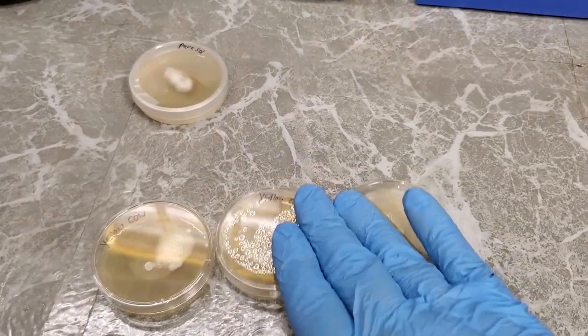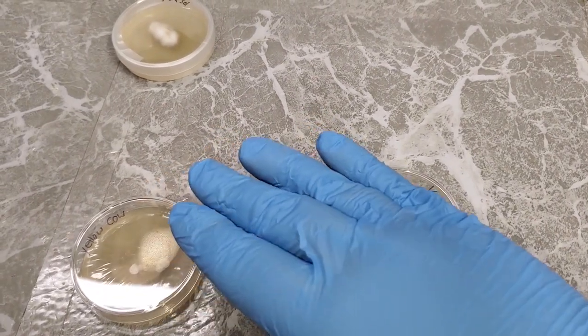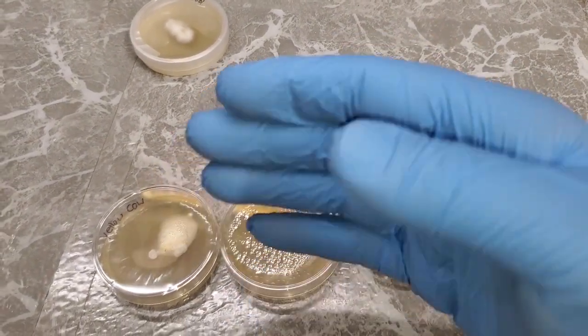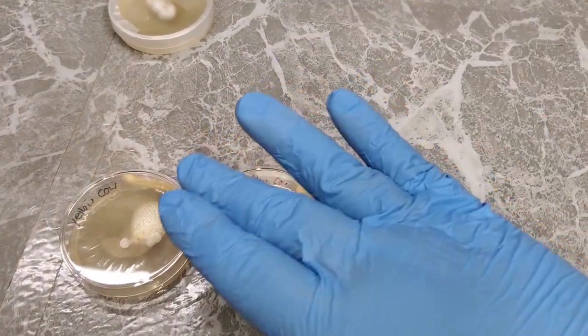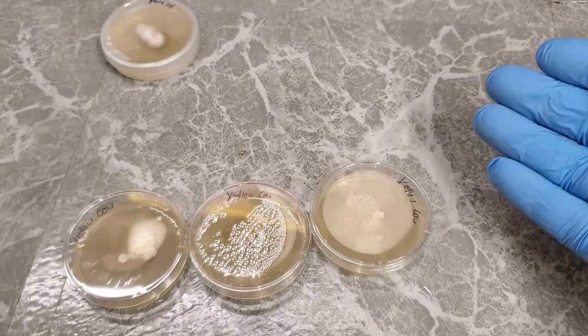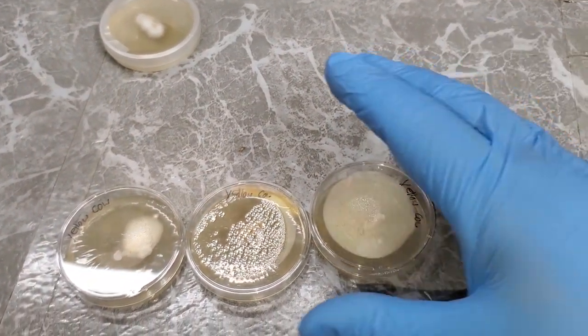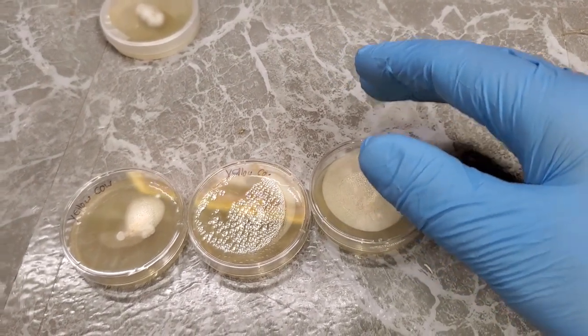cultures themselves. That being said, from those 15 chicken mushroom clones that I have on agar, I do have some that are perfectly fine with absolutely no contaminations, which is fantastic, but I also have a few, as you can see here, that did get contaminated. I wanted to show you that it's going to happen. It's annoying as it is, but this is going to be a fairly common occurrence, and this is something that you're going to have to deal with.